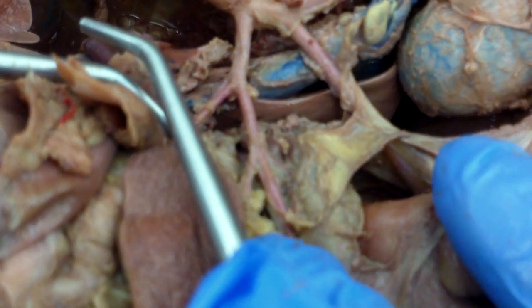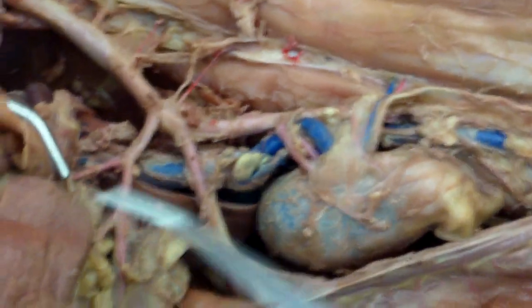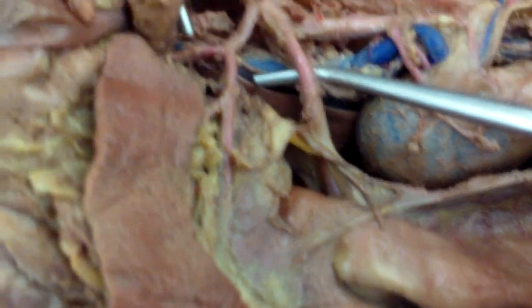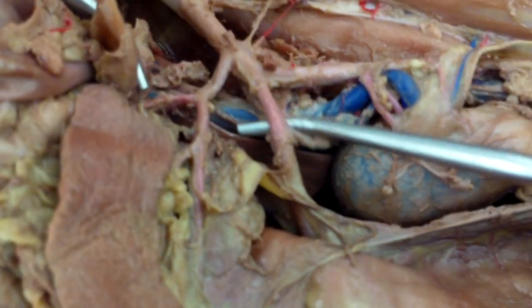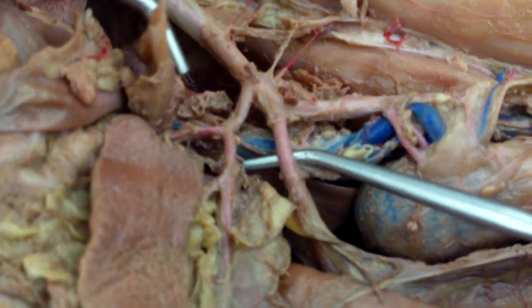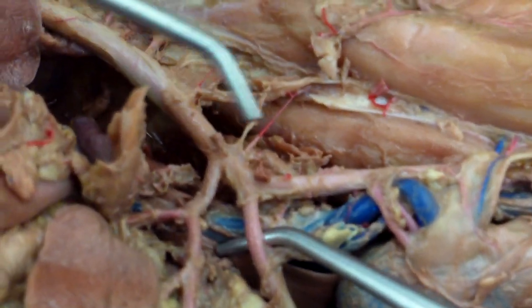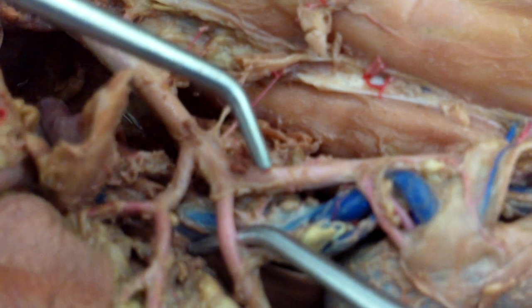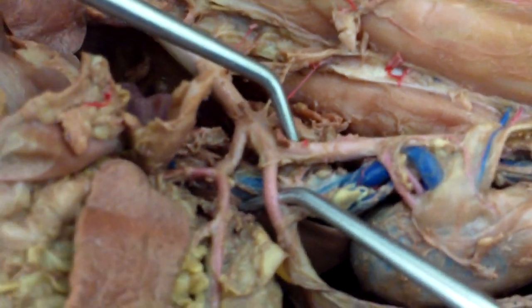Then you have your superior mesenteric, which goes to the small intestines — that's this big guy right there. And we actually cut off our adrenal lumbar, so that should be right here — we cut it off.